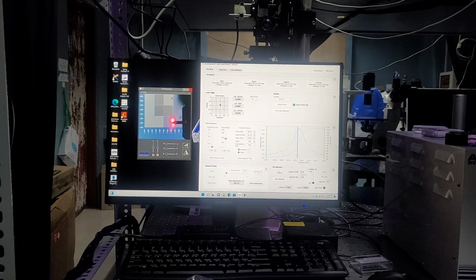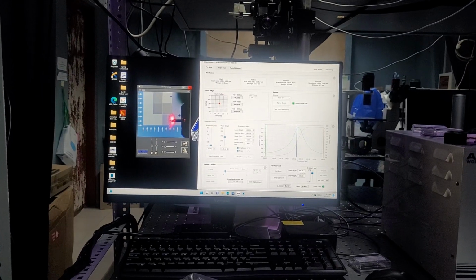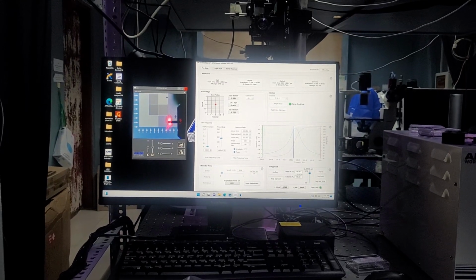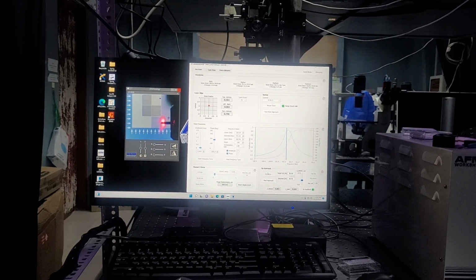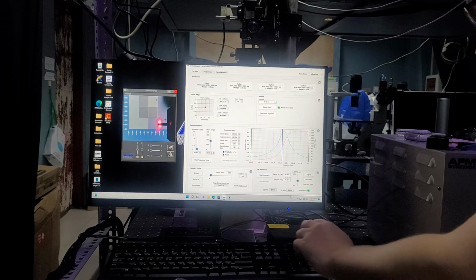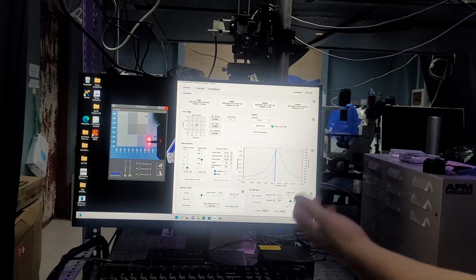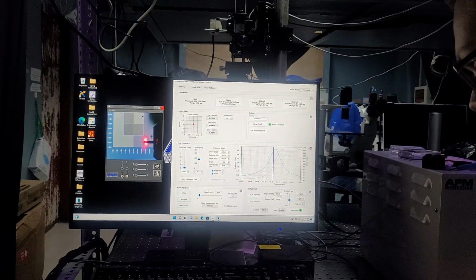So then I'll go ahead and tip approach again. Okay, here we go, we're back on the surface. So I'll go ahead and check, say from 80 to 79, it moved. 79 to 78, it moved. From 78 to 77, it did not move, so I'll move 1 to 3% below that, so I'll just go to 76.